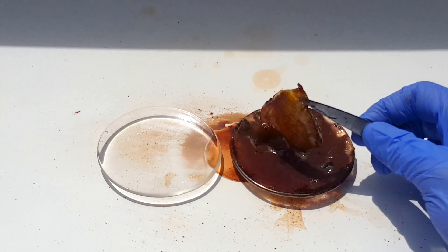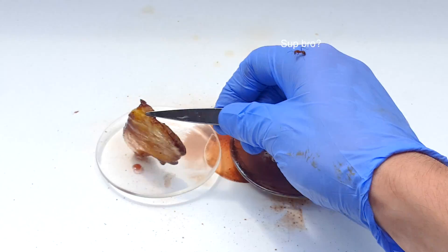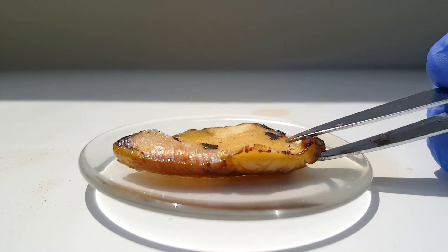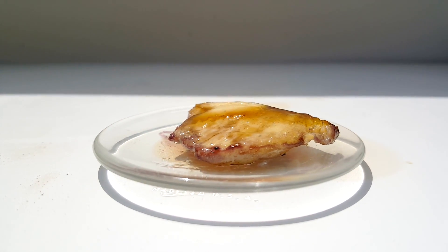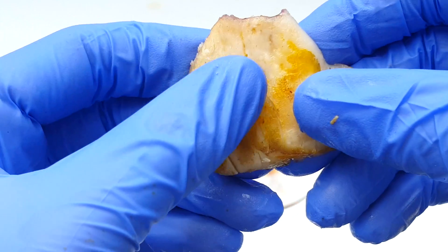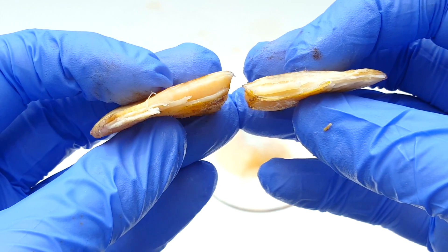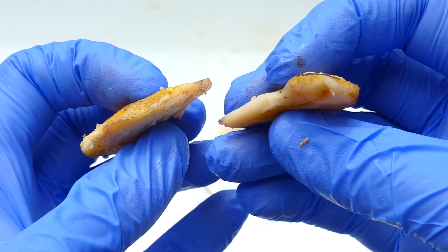You can actually see the chicken breast being slightly singed as the proteins are being denatured — it's essentially being cooked. On further examination, the chicken looks like it was cooked on a pan with some balsamic vinegar. Of course this is far more toxic and I would never advise eating anything you make out of a lab. After wiping the chicken off and breaking it in half, you can see that the chicken cooked all the way through. Considering that neither the chicken nor the petri dish were substantially warm, this is only due to the chemical processes involved in denaturing the proteins.